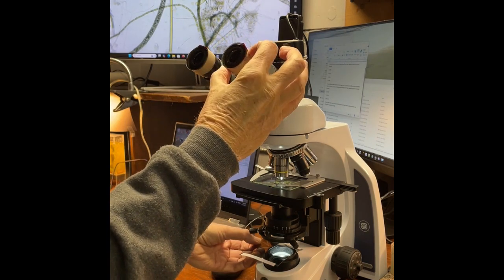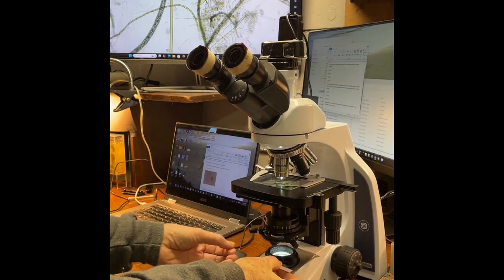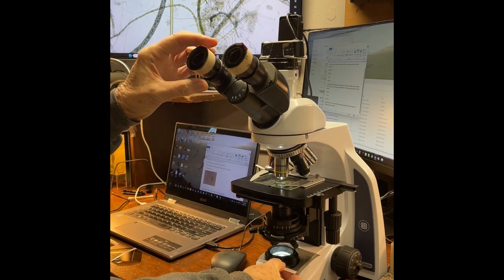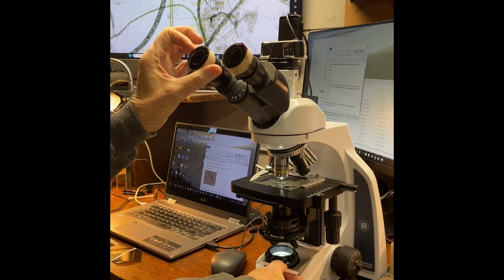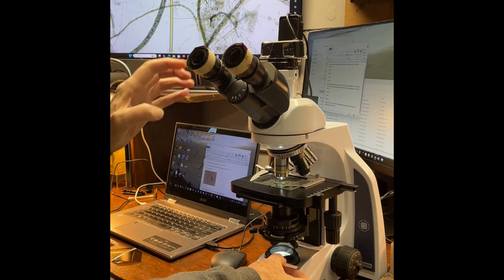the right eyepiece filter to get the darkest view. Then move the assembly so the left side covers all the illuminator and do the same for the left eyepiece filter. Now you should be able to see the sample in 3D.